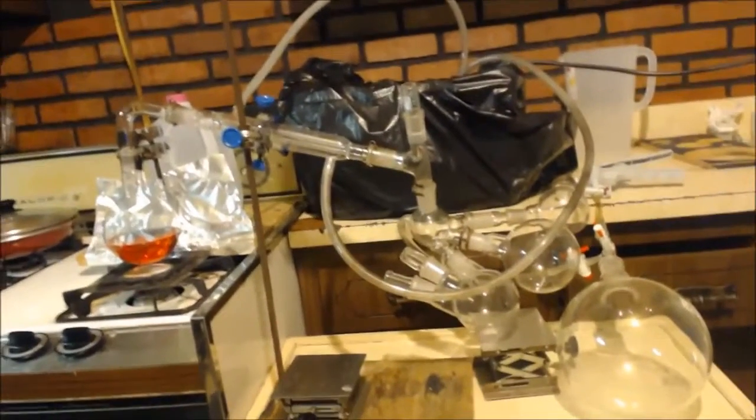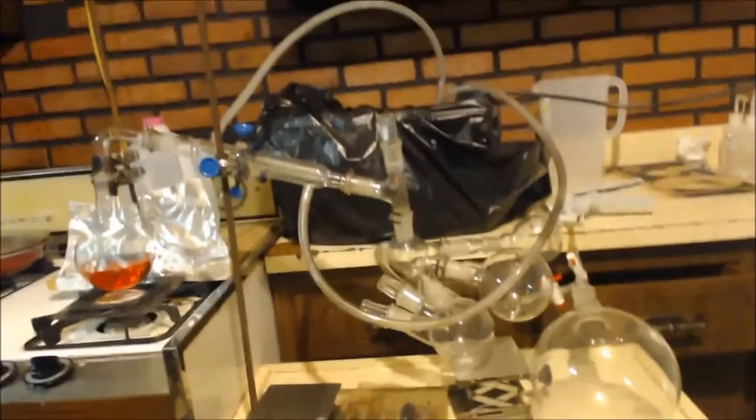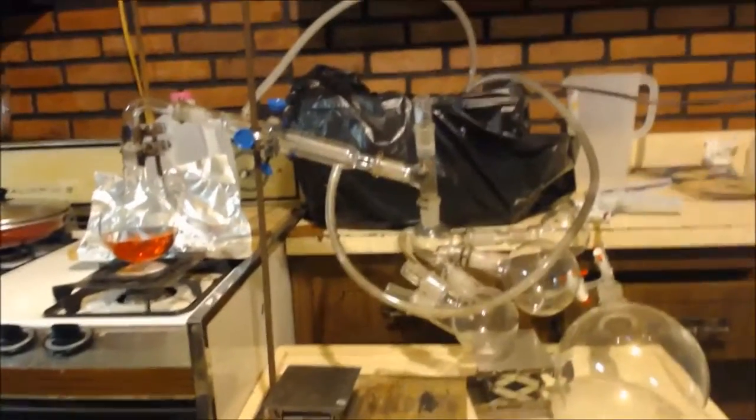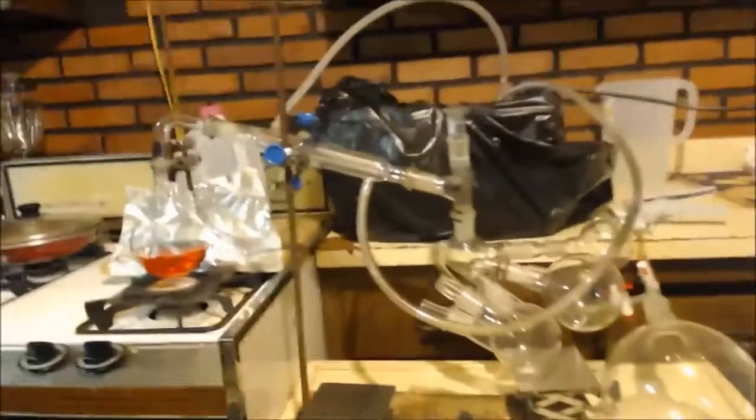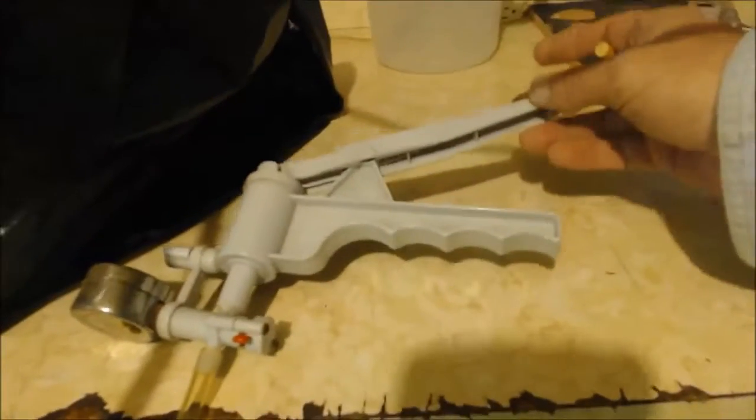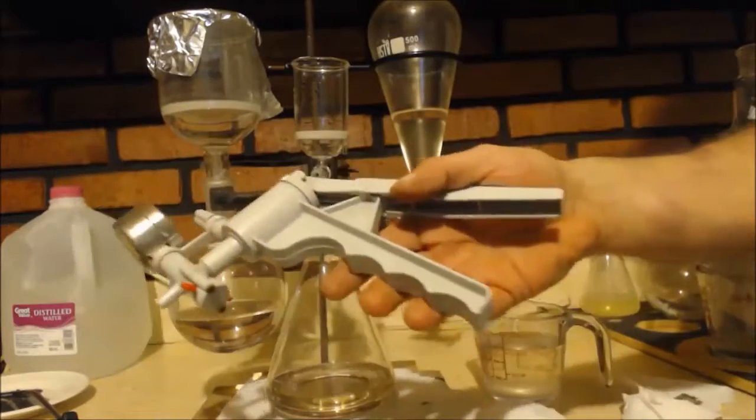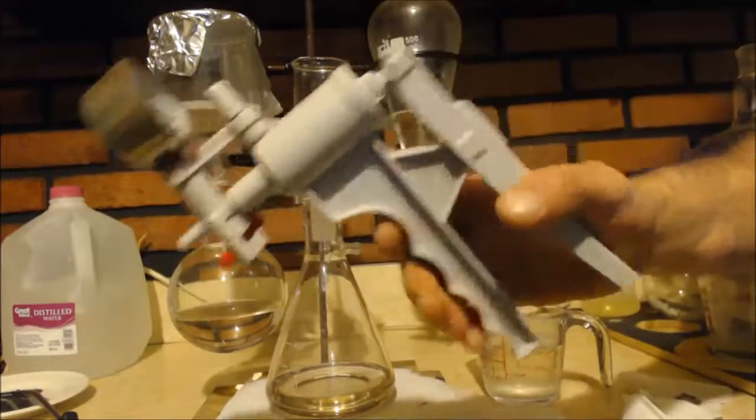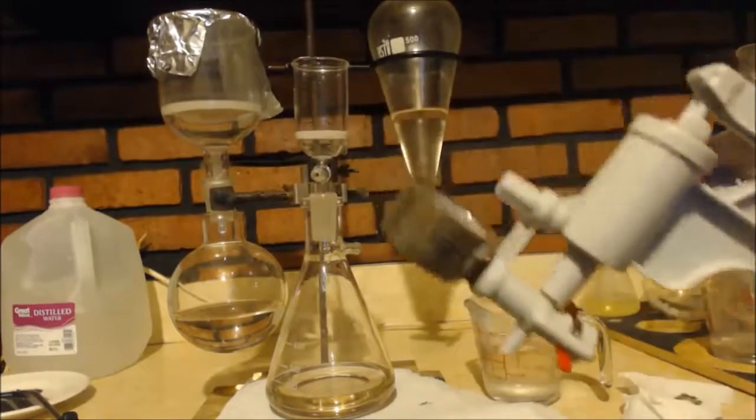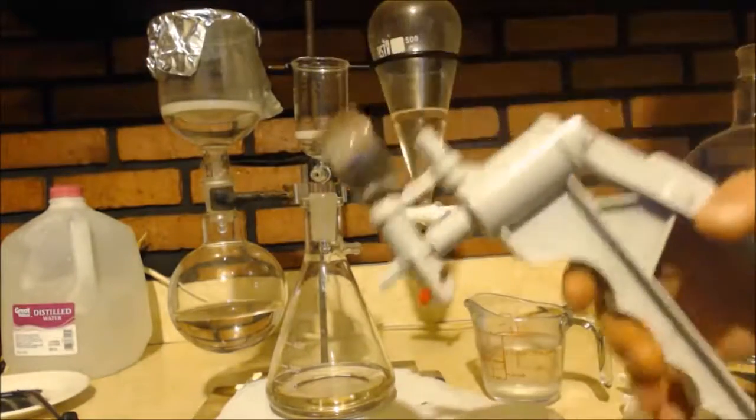Alright. Well, there's my apparatus. It looks more complicated than it is. It's just a simple distillation. I was going to use my vacuum pump, but I hate that thing. And I just realized something with this hand pump. I can actually use it when I was, you know, not putting any heat, applying heat to the system. You know, it wasn't boiling.